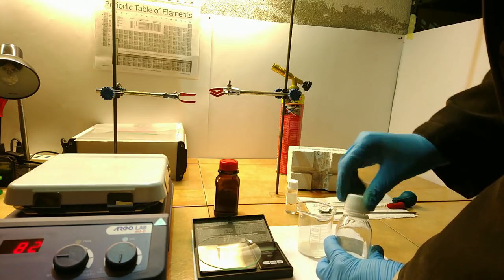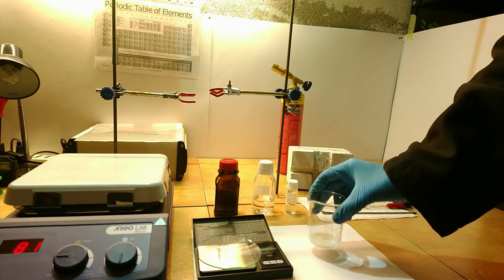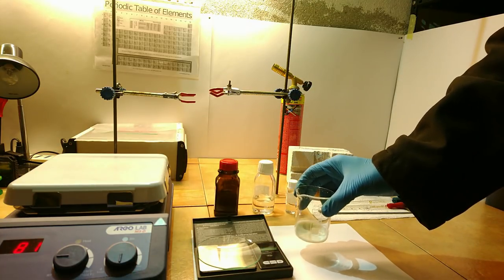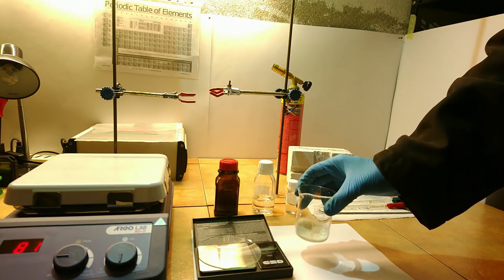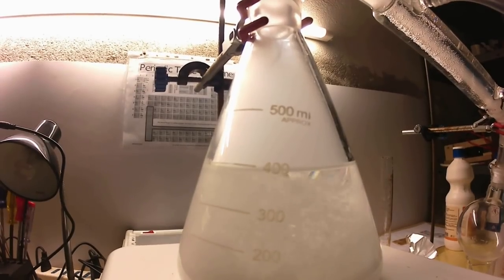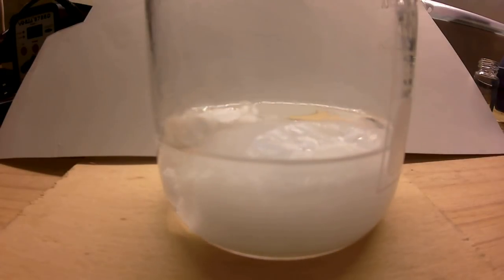You can make ammonium chloride from household ammonia and hydrochloric acid, but you have to purify it by recrystallization.